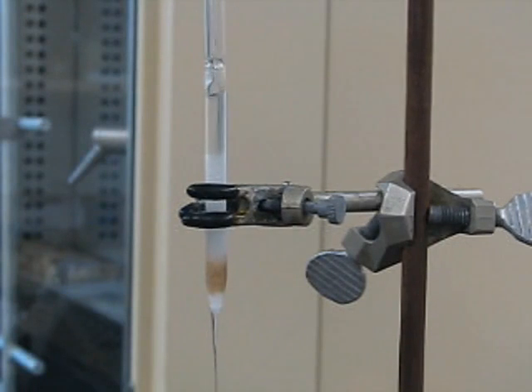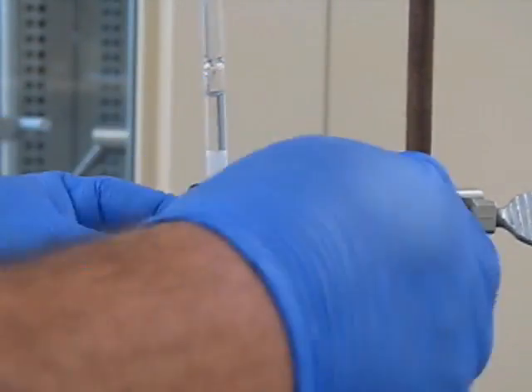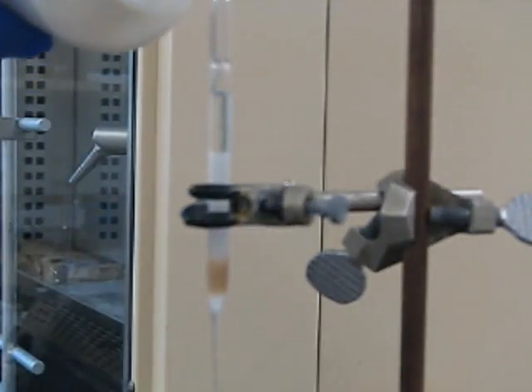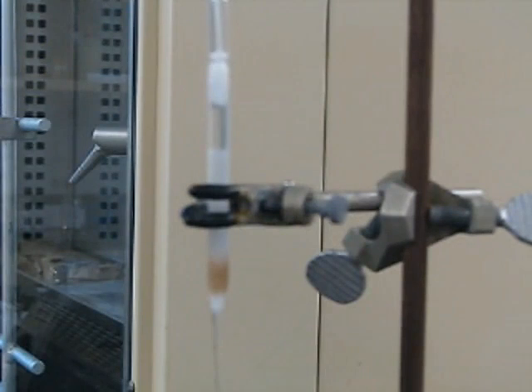Alright, so you have your pipette clamped. And again, you're mixing up the silica. And I'm just going to add a little bit more. Always want to make sure that the solvent level is above the silica when you're preparing it.